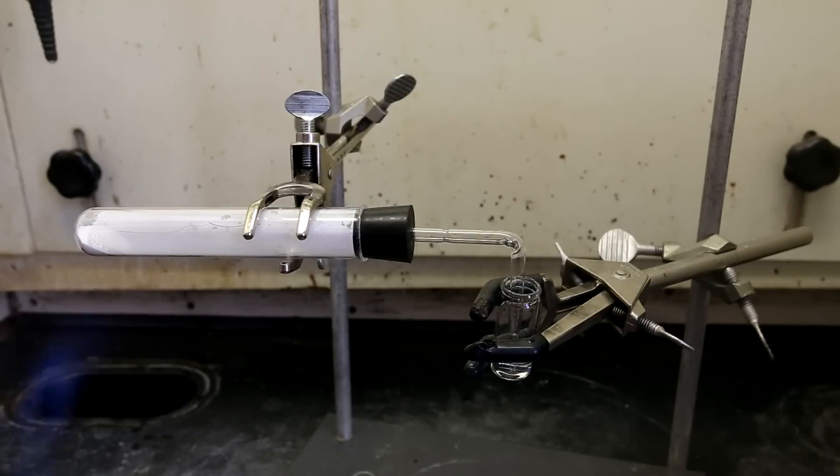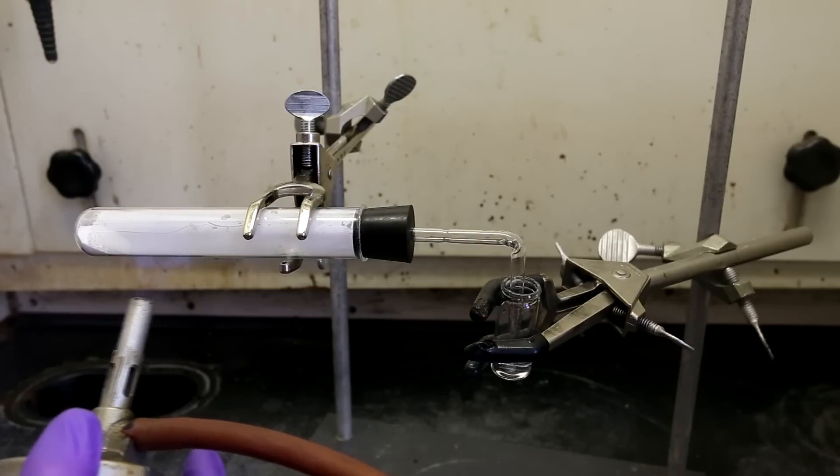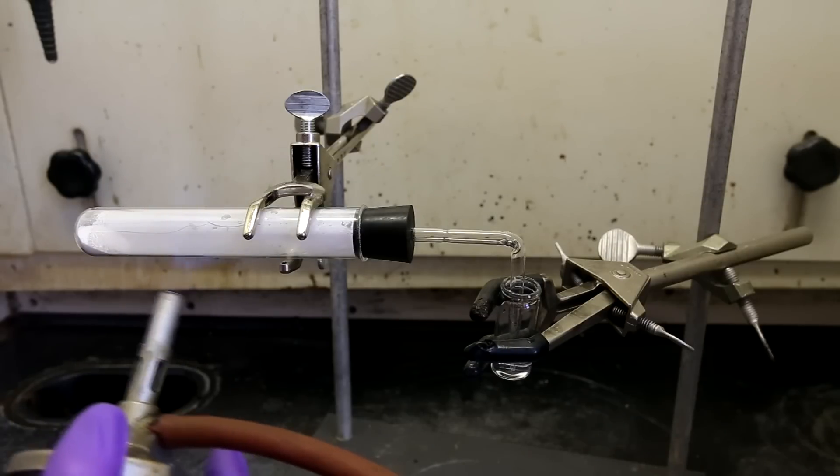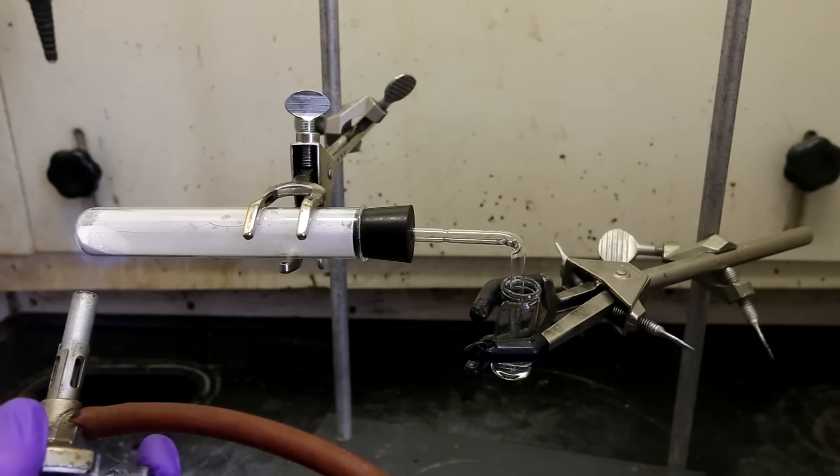Inside the tube is filled with nitrogen gas. There is absolutely no oxygen. Because there is no oxygen, nothing inside the tube can combust. This means that even if I apply a lot of heat, the product cannot burn.